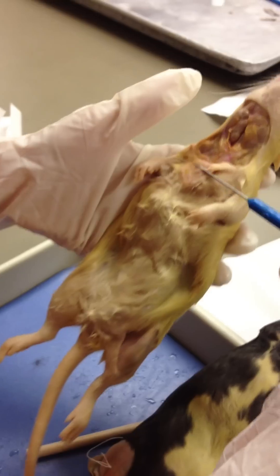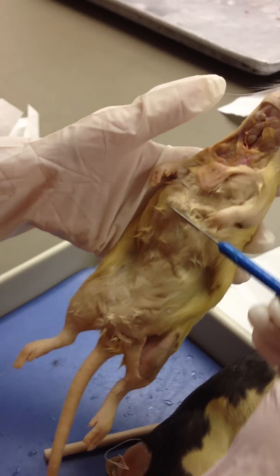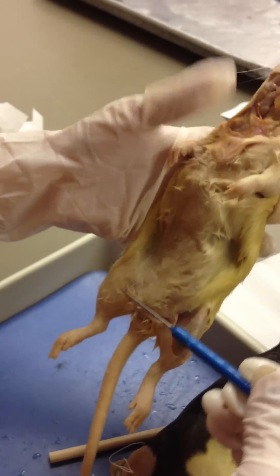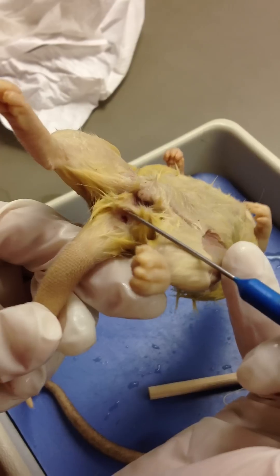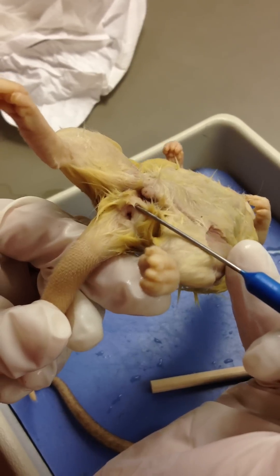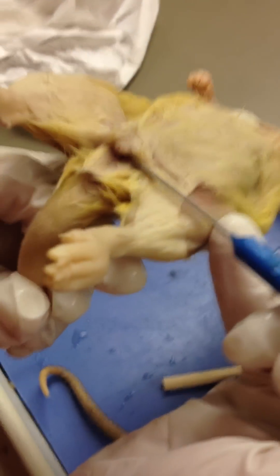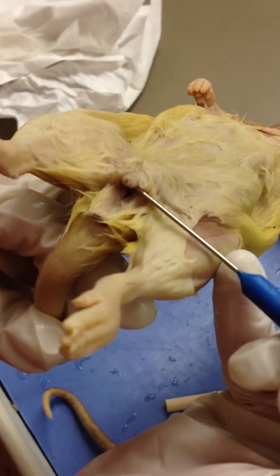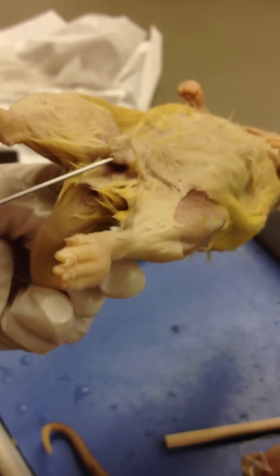Here's your trunk and abdomen. This is a female. Females have these separately — here's an anus. That hole right there is your vagina and your urethra.